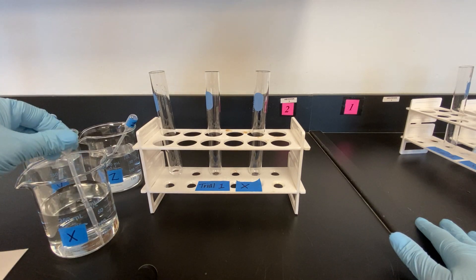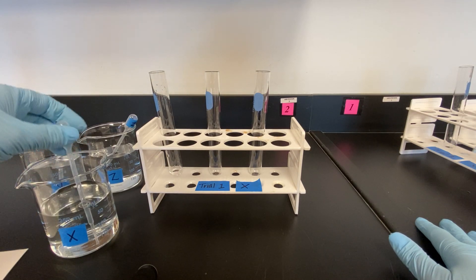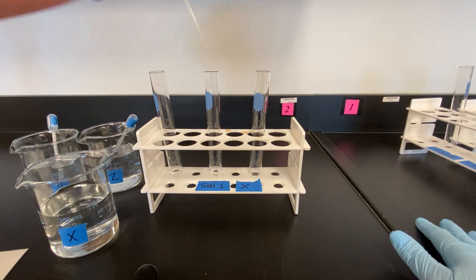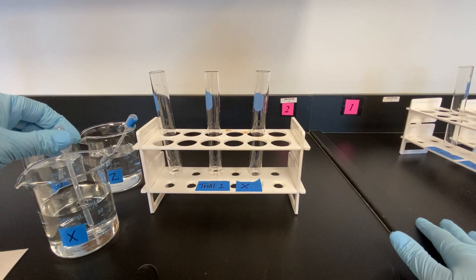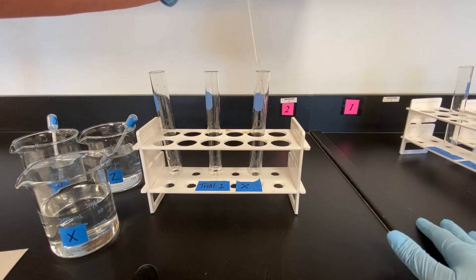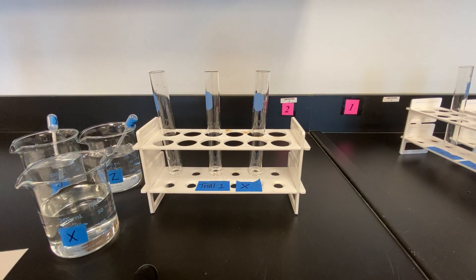We are using a 1 ml pipette. And now we will begin the experiment.